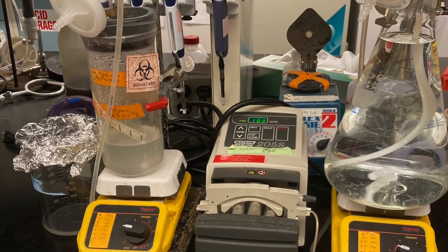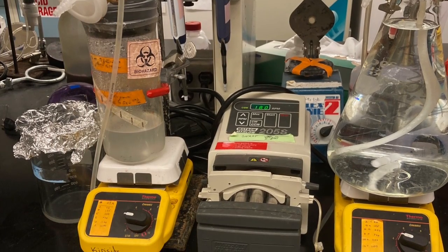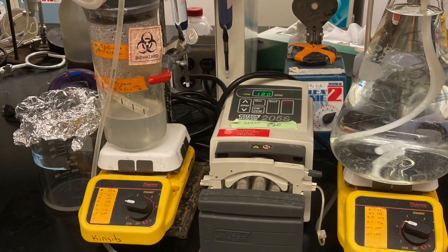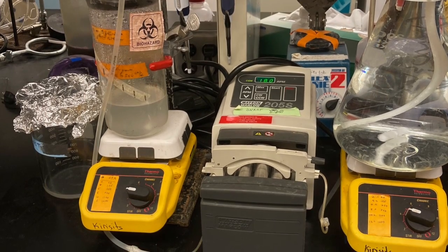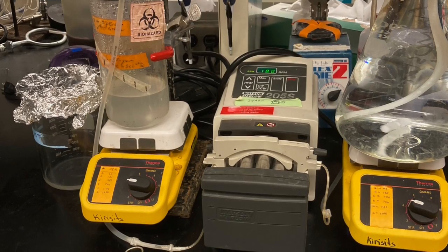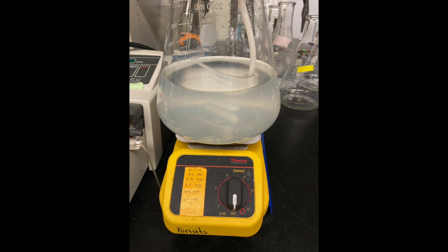To maintain the chemostat, never let the media chamber go below 400 milliliters. This means that fresh MD plus glucose must constantly be added to the chemostat using aseptic technique. The adjacent waste beaker must also be constantly emptied and sterilized with a bleach solution. The chemostat must be maintained with aseptic technique.